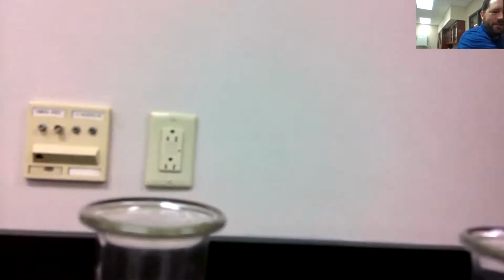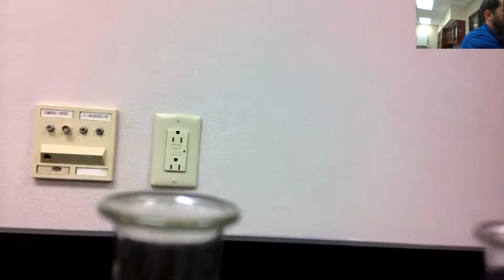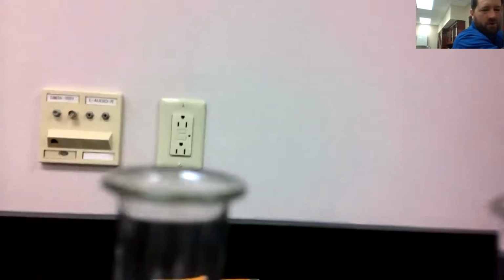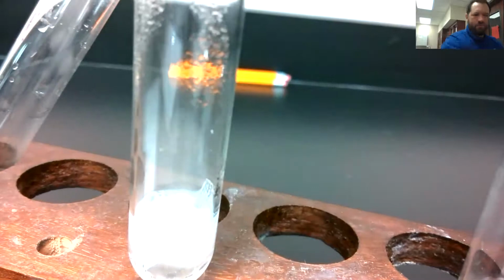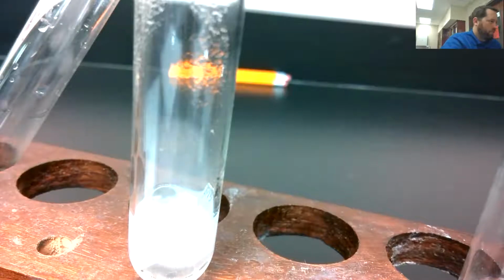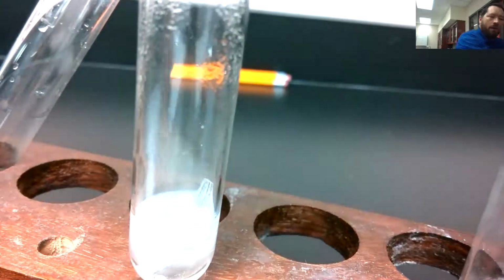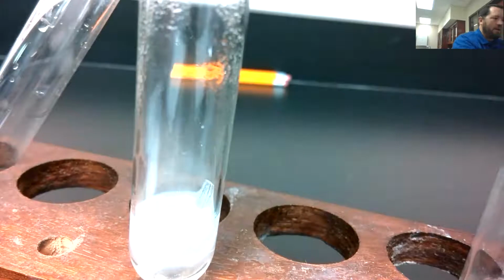And again, that's really cool. You can quite see that. There's a little bit of smoke, it's not actually smoke. Cool just looking at that smoke coming off the top. Show it to you on the video though. There we definitely see it. Pretty cool, huh? Touch, quick feel. Yeah, it's definitely warm. Definitely some warmth there. Again, not as hot as that first one got, but definitely feel some warmth.